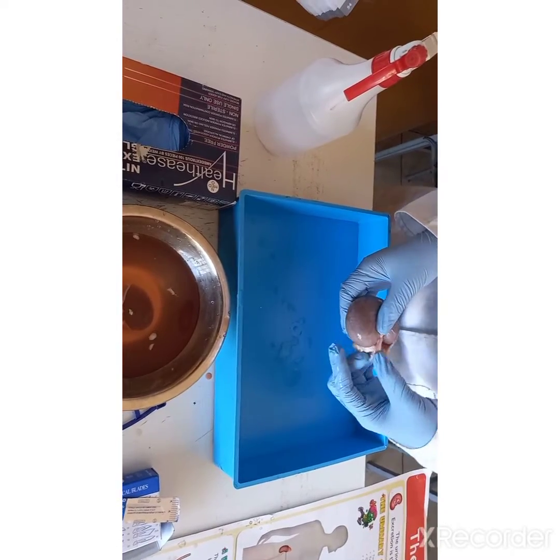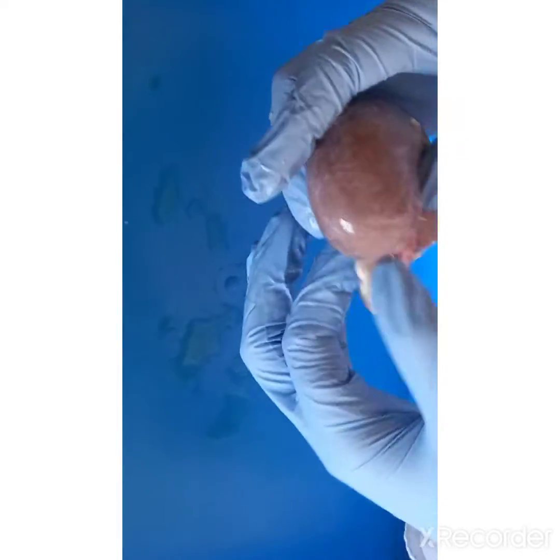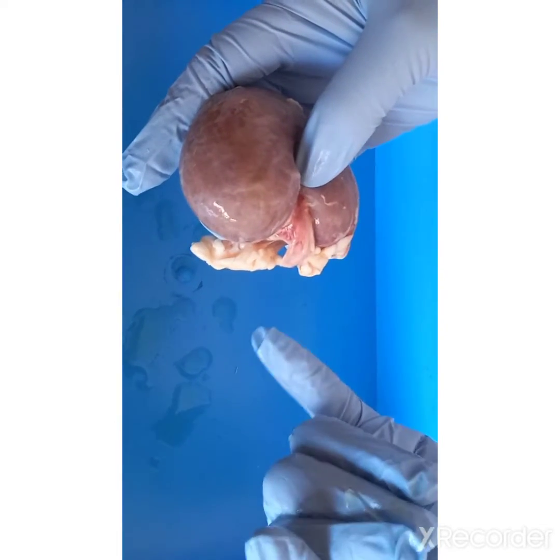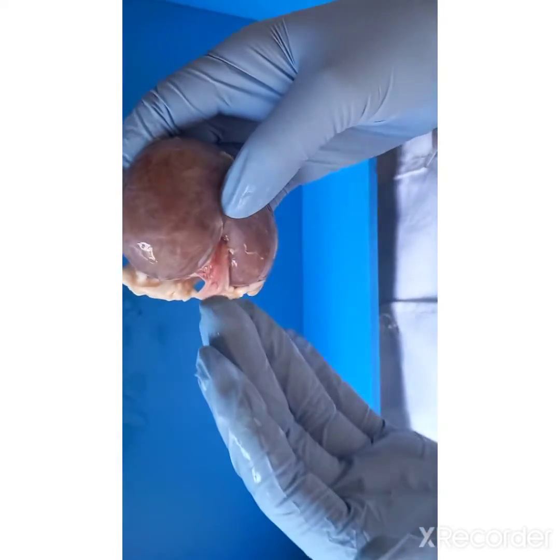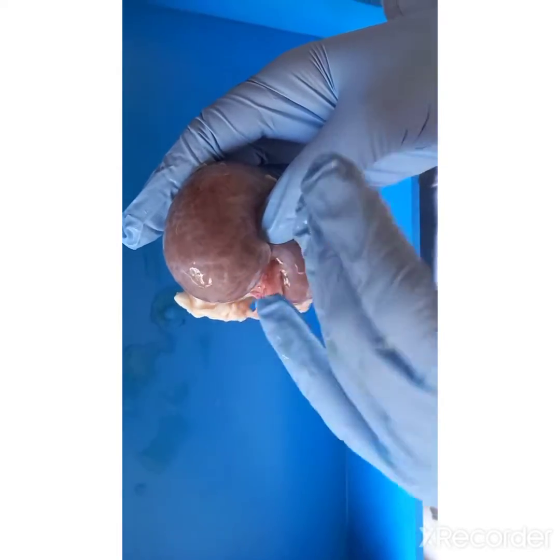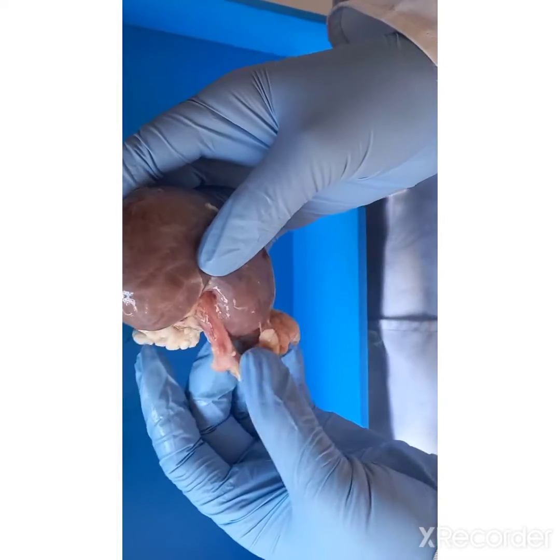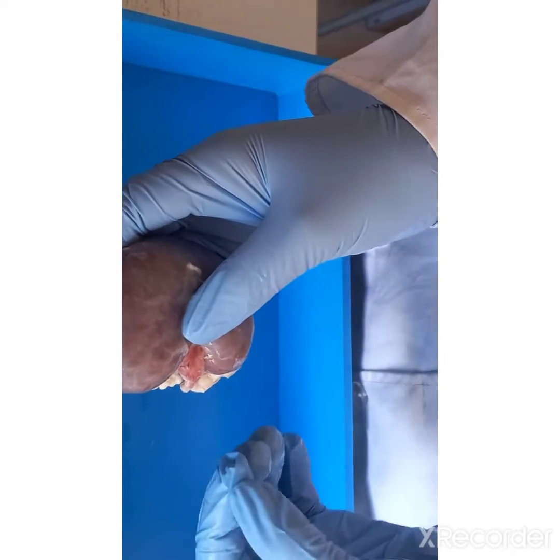Outside our capsule, we will see two vessels and one tube outside here on this region. Our first vessel will be the renal artery, which transports blood from the heart to the kidney. And then we'll have the second vessel, which is our renal vein, which will remove the filtered blood from the kidney to the heart. And then we'll have our tube, which is called the ureter, which transports the urine to the bladder.